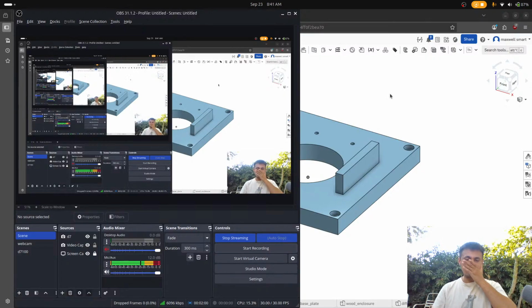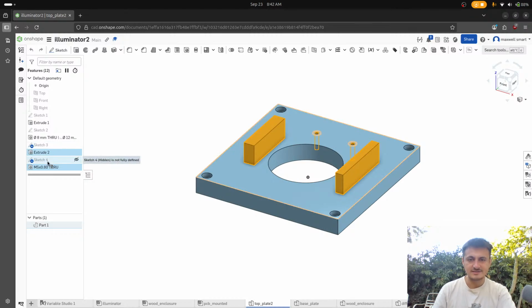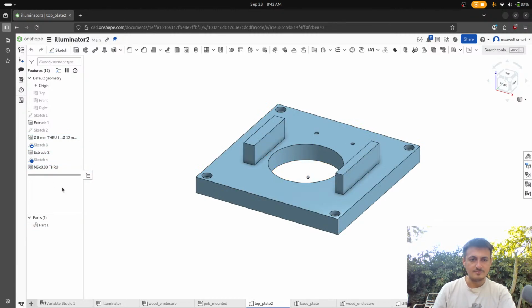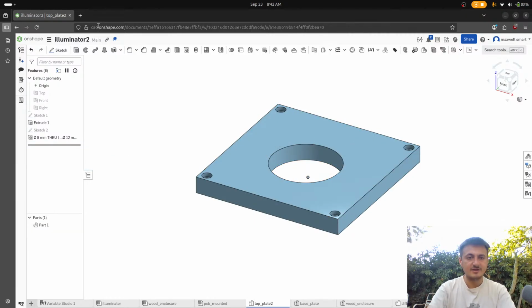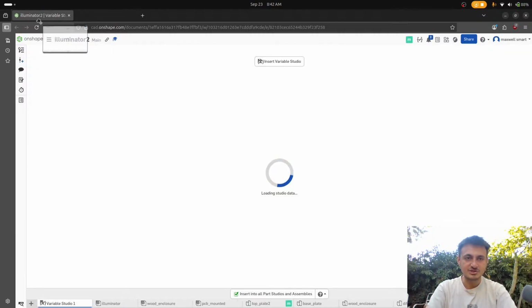All right, let's get on to the CAD side of things. So this whole thing, I hated this. I really didn't want to do this, and I was thinking like, what could I do that would make this fun? And what would make this fun is using something that I've always wanted to use that is overkill and probably not even going to work that well. But we're going to do a couple of things. And the main thing is we're going to use aluminum extrusion.